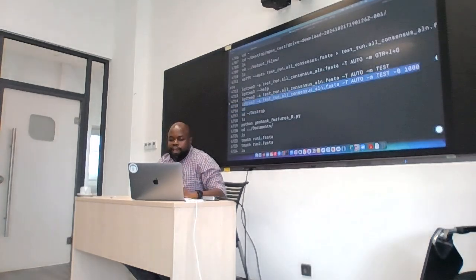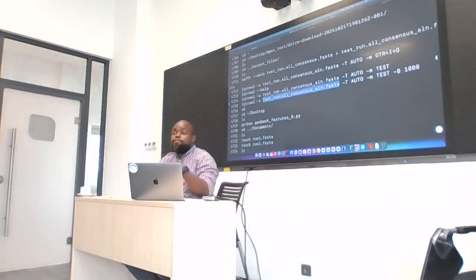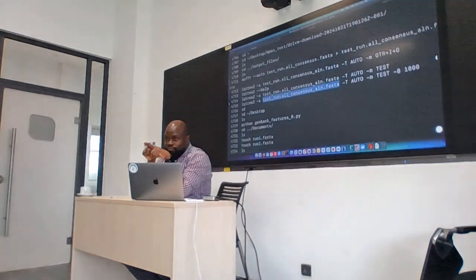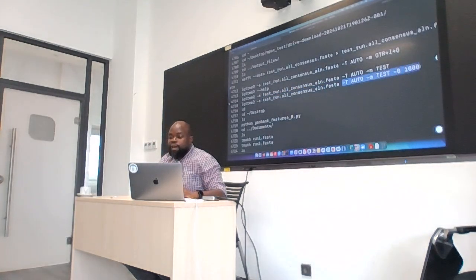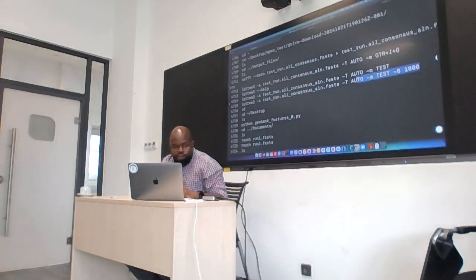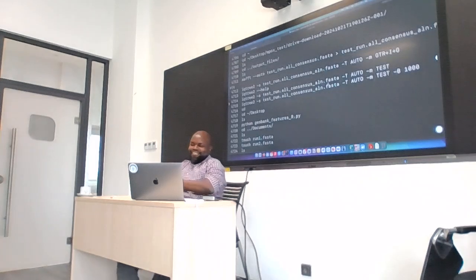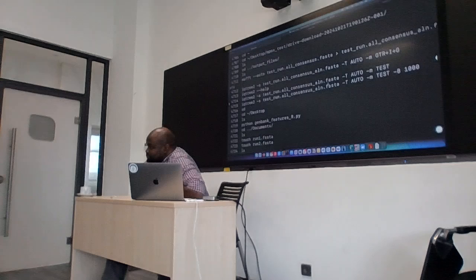So you're going to say iqtree -s, then give the name of your alignment file. Okay? And then the rest of this will be the same as mine. I'm just going to copy this, put it into that document. Or have you put it already, please? Okay, cool. Thank you. Now, off you go to the terminal. Execute this one.